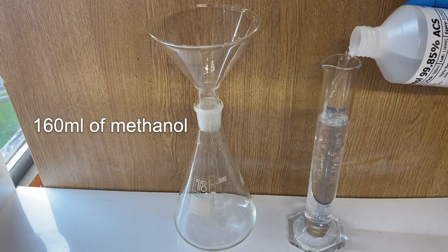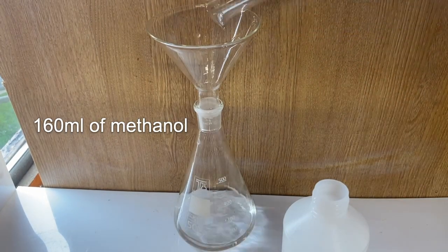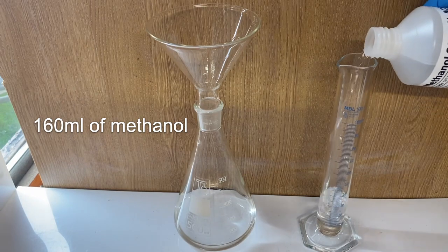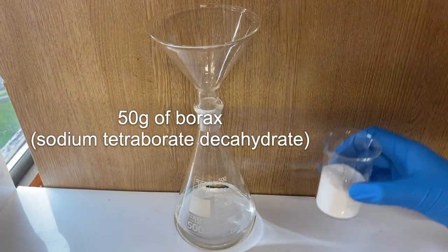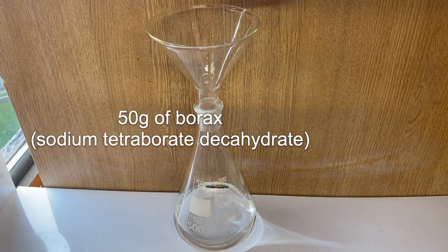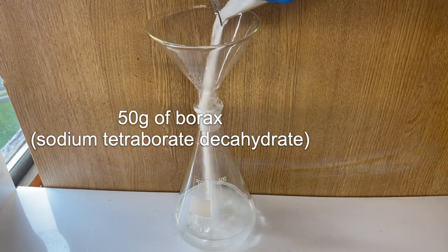To begin, 160 milliliters of methanol was measured out and added to a conical flask. This was followed by 50 grams of borax or sodium tetraborate.